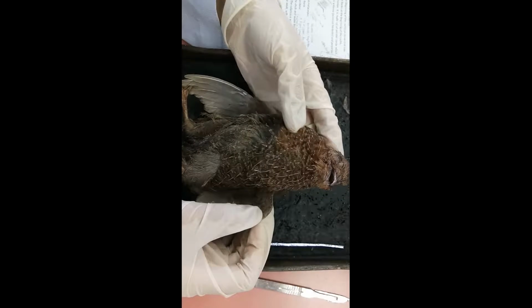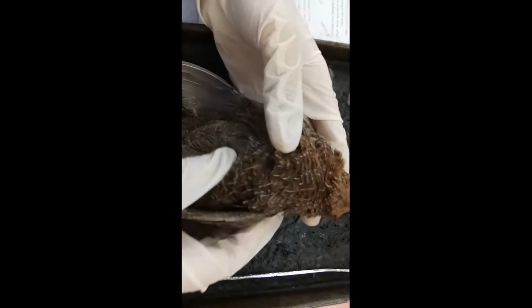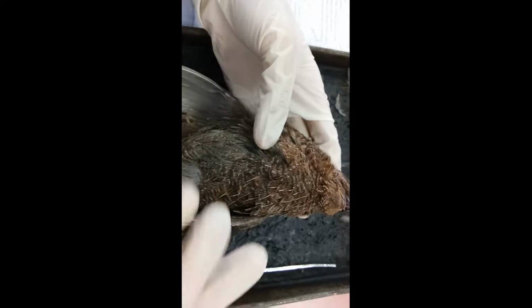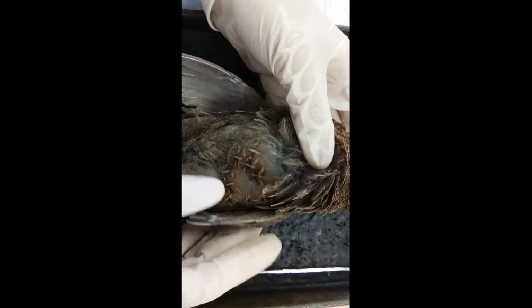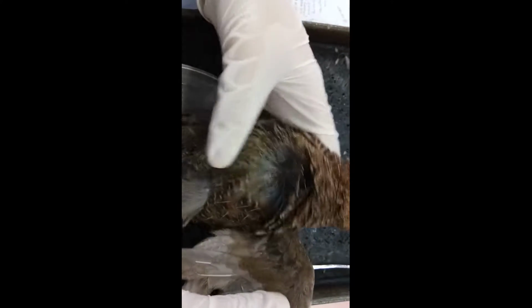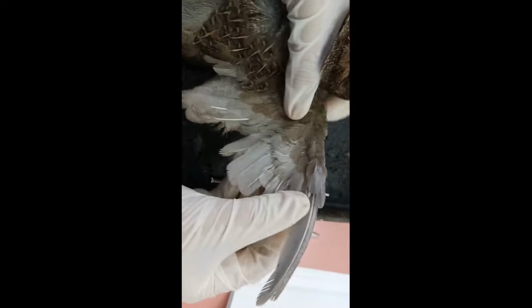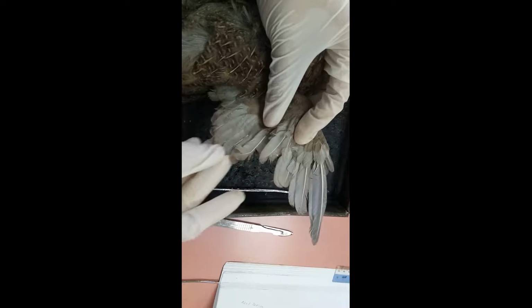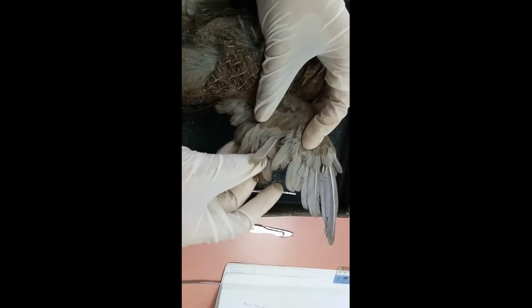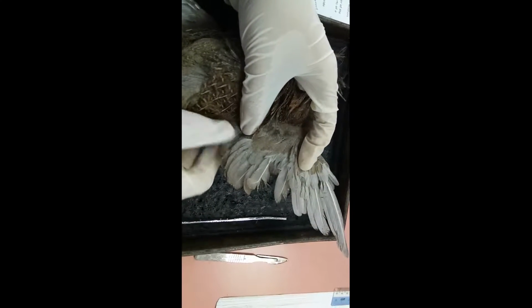Feathers have 3 types. First is the contour feather. The contour, as you can see, is normally on the body surface of the birds, like this contour. For the remiges, the wing section can be divided into 3 types. This is the primary remiges, the first 10 digits, the secondary remiges, the next 10 digits, and the tertiary remiges, which are the lower remiges.